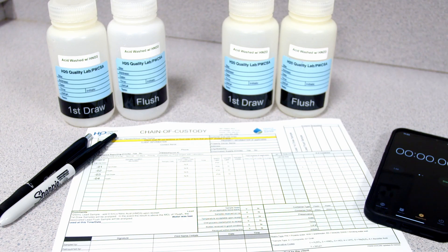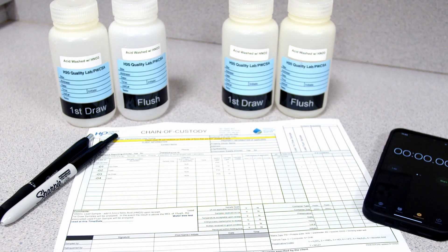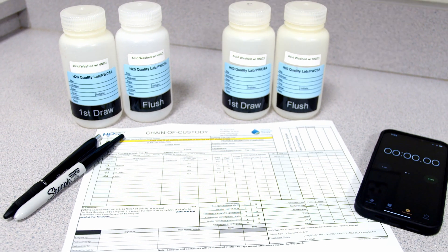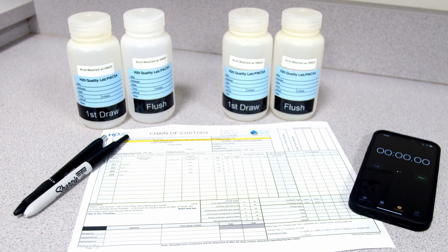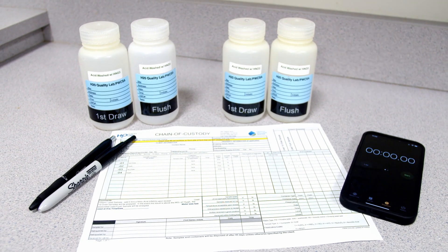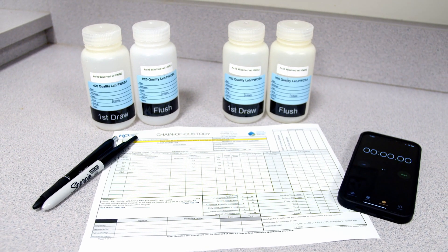Now let's take a minute to look at the sampling kit. Each kit has 250 milliliter bottles, labels, and a chain of custody. You will need a permanent marker and a phone or clock.